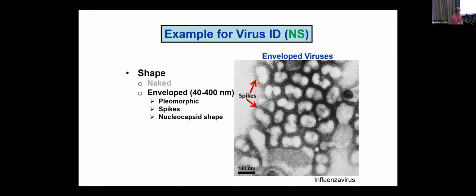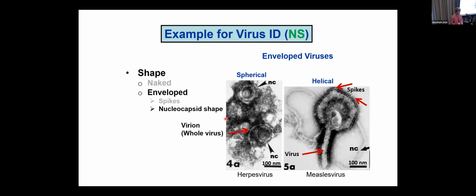These are the hemagglutinin, and the spikes are the things that attach the virus to the cell. And inside the virion, which means the whole virus, the inside is the nucleocapsid and the outside is the envelope. In an envelope virus, we need to look at the nucleocapsid shape if it's visible. Here it is not. Here it is. So here's another example of an envelope virus.